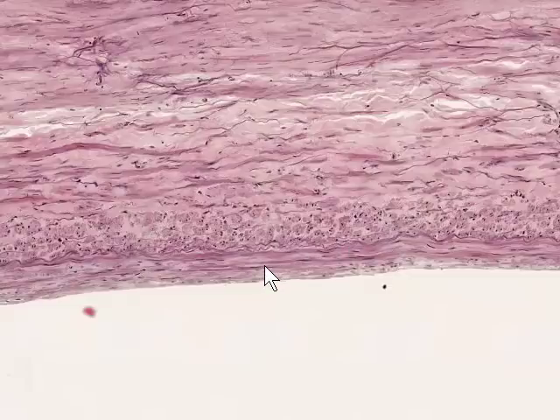One thing you may notice is the connective tissue that forms the tunica intima. It's quite thick, but not quite as thick as you would find in the aorta. And there are these cells with elongated, sometimes spiral looking nuclei, although it's not evident at this magnification. Most of these are fibroblast-like cells, but there are occasional scattered smooth muscle cells found in the tunica intima.